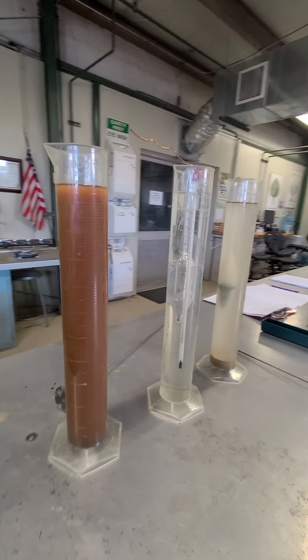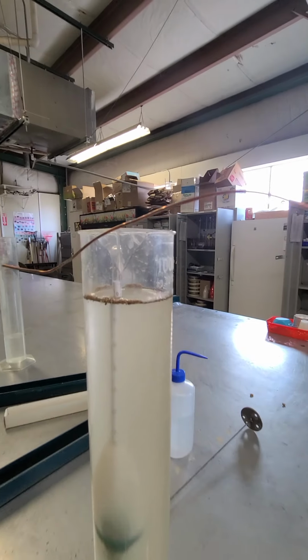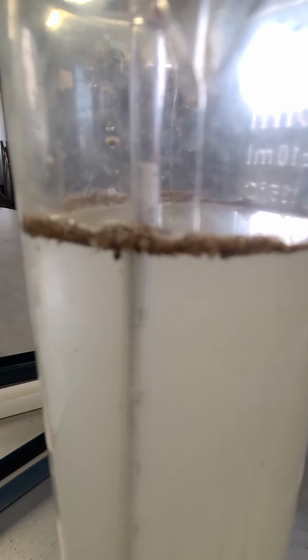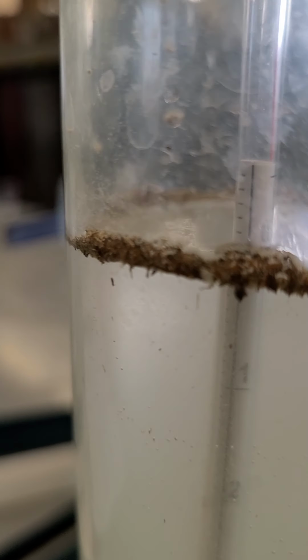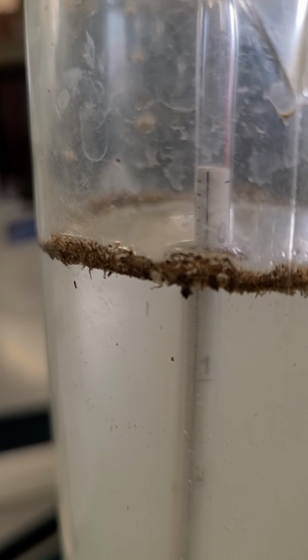So let's go ahead and just move around this direction and see if we can read the hydrometer on this first one. Well, look at that. I don't know if you can see that, but it looks like it's pretty much sitting at, let me focus that. Look at that, sitting at 0 right there. It's barely reading anything. So that's actually pretty interesting that we've got something that's that low.